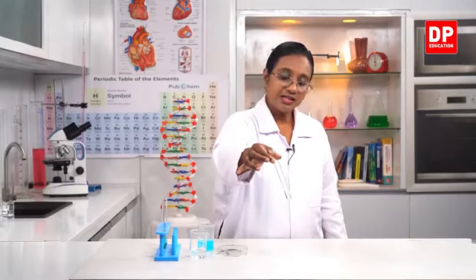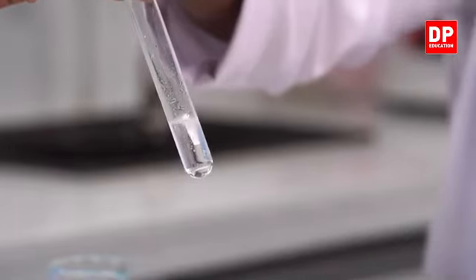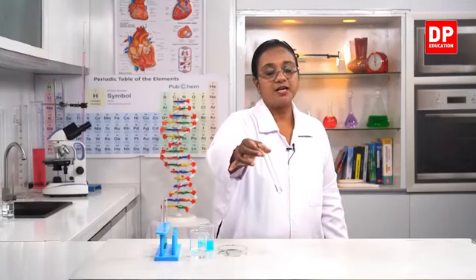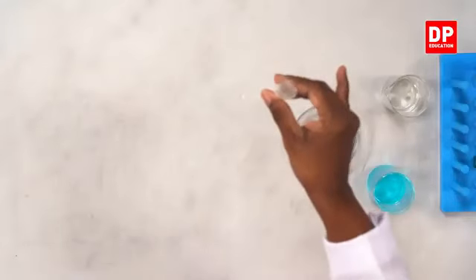Evolving of a gas or liberation of a gas, you can see that clearly. Can you all see that clearly, students? Here, if you look closely, you can see the liberation of gas. So that is the hydrogen gas. So again, if we leave this for some time, you can see the complete reaction would have taken place. So I will keep it on the stand. We will observe the previous reaction again.